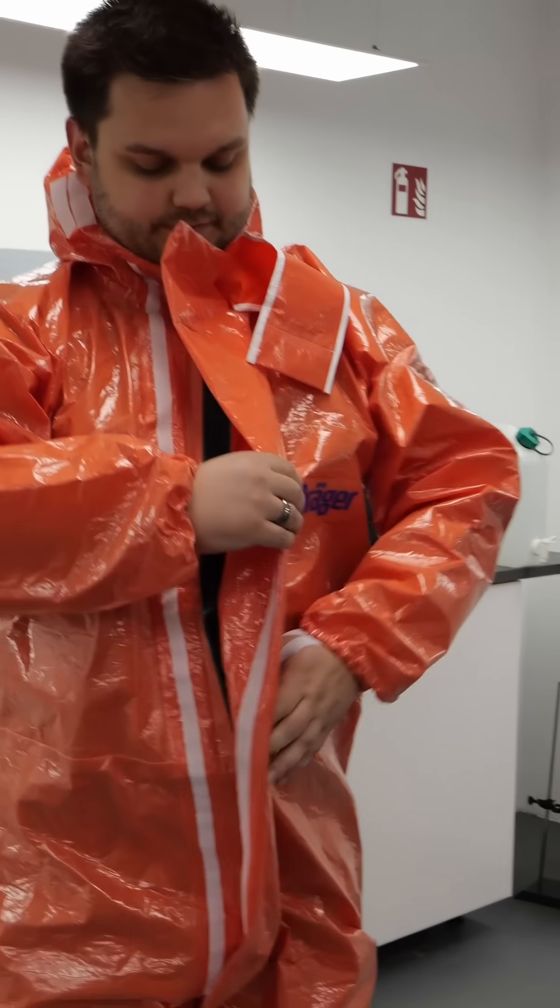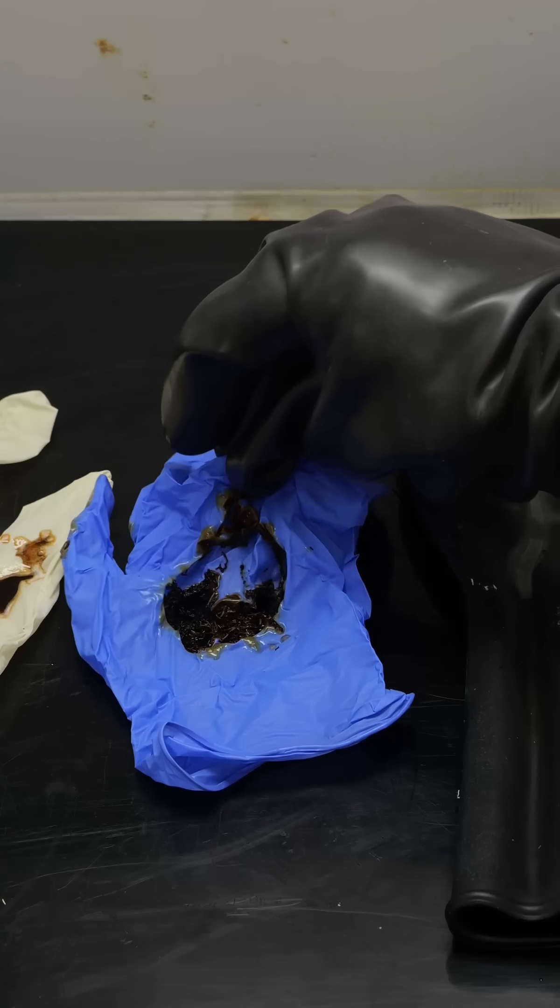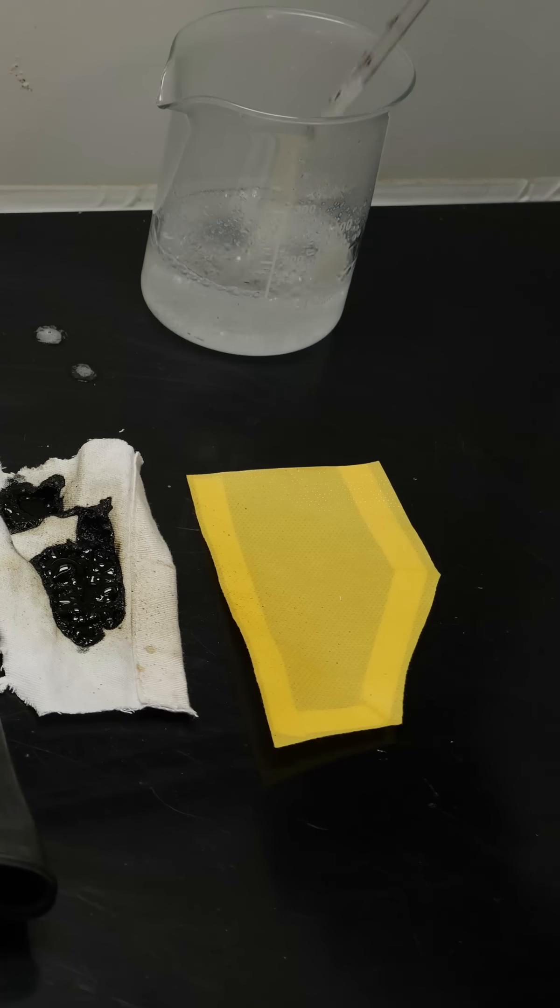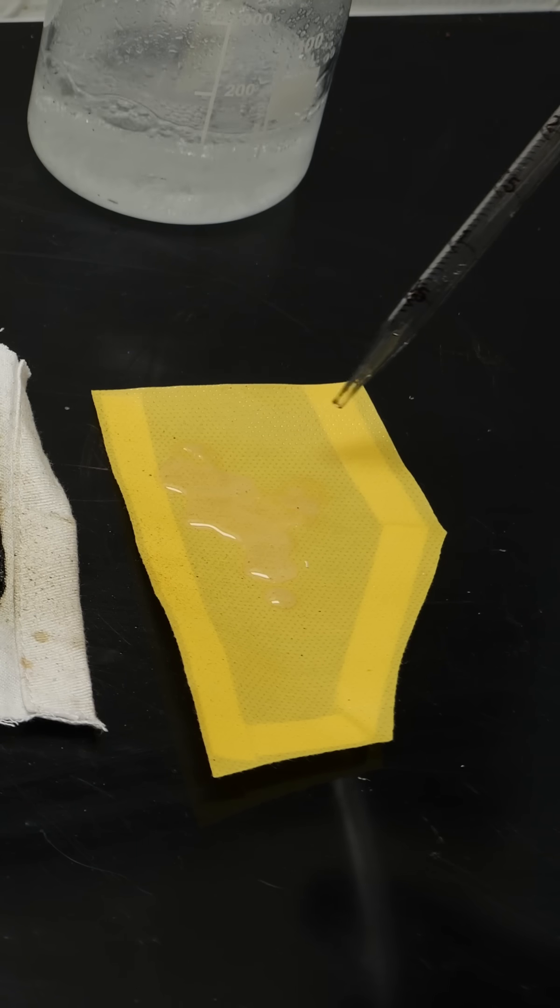To protect myself from piranha acid, I wear a chemical protective suit made with German quality craftsmanship. But seriously, does the suit actually protect me? When you think about the nitrile gloves, it does raise some doubts. This is a piece of a protective suit in yellow, and it's now going to face off against the piranha acid.